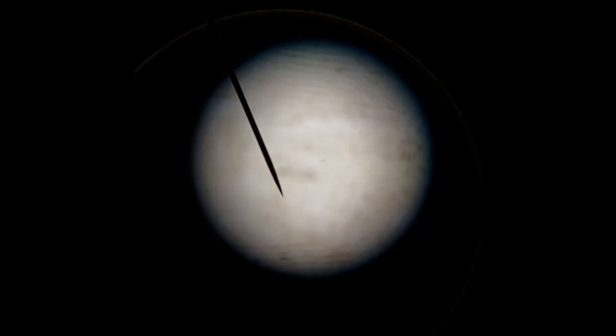Using the coarse adjustment knob, I can then lower the stage. Oh dear. It's a bit bright, isn't it? Let me just adjust that a bit. There we go.